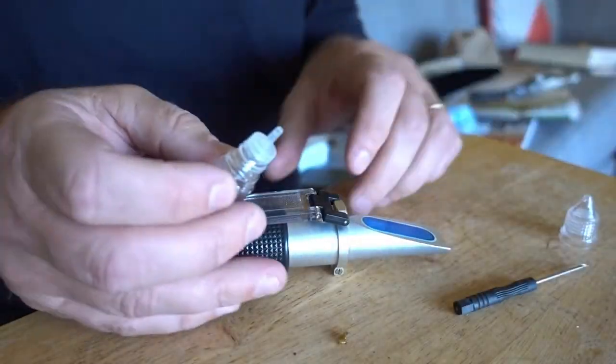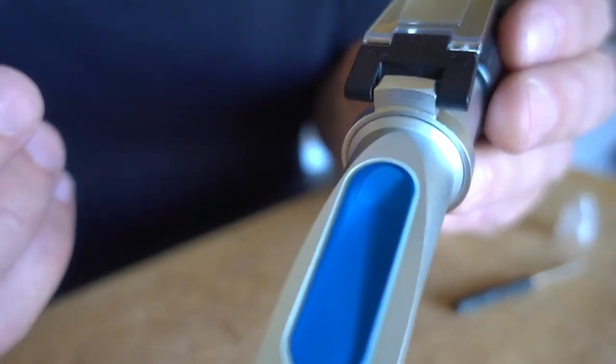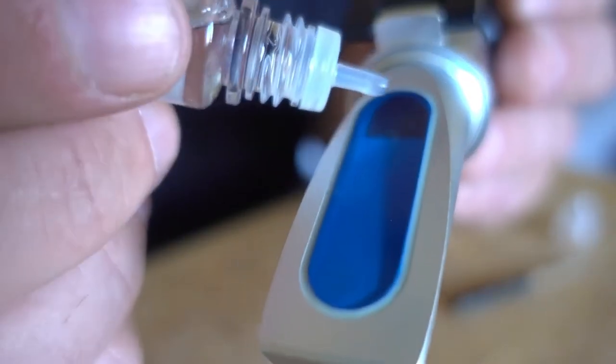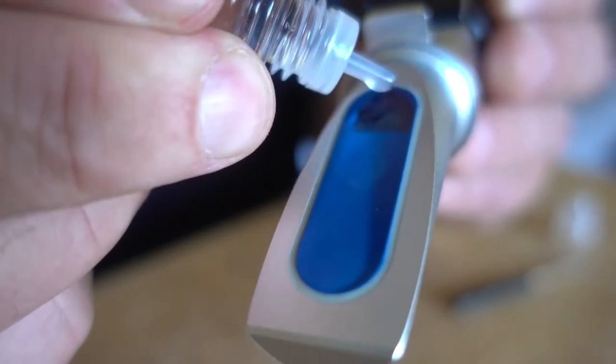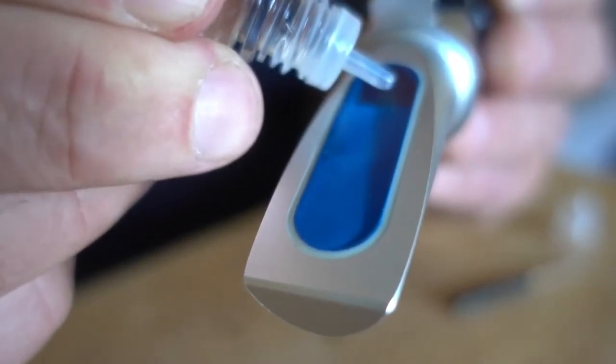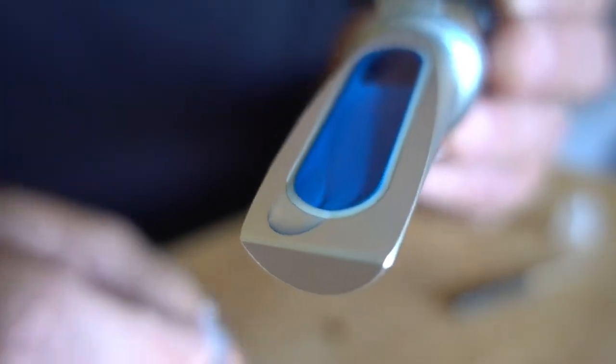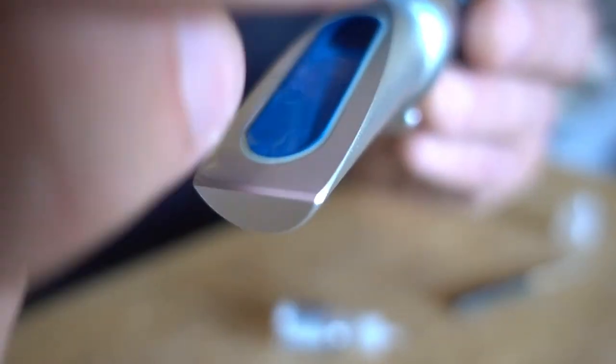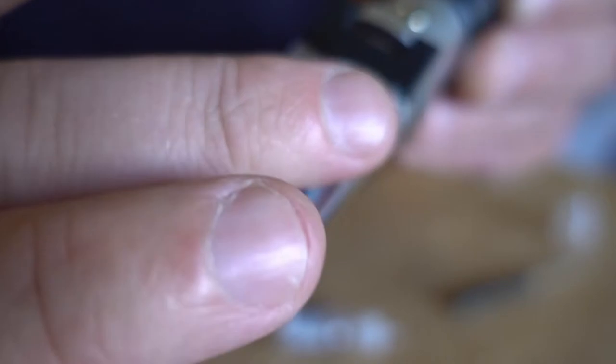So let's see if this works, just swoop a little bit on there like so, here it is and I'm just going to, I don't know how much to put on, just put a whole bunch on. I'm just going to rub it around, I'm going to squish this thing down, see that, and now I'm going to get a reading.